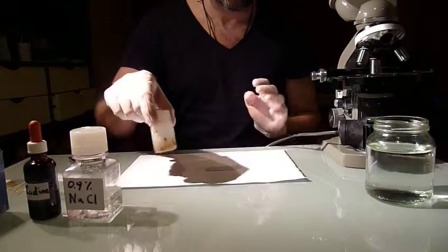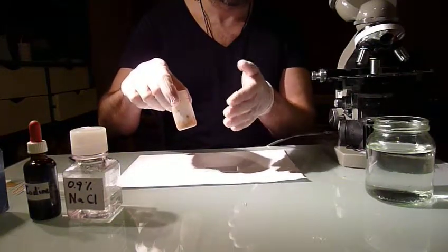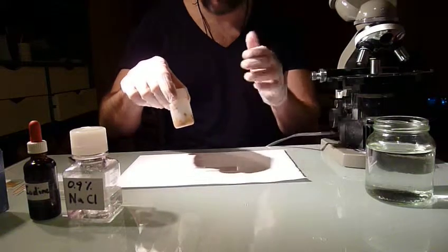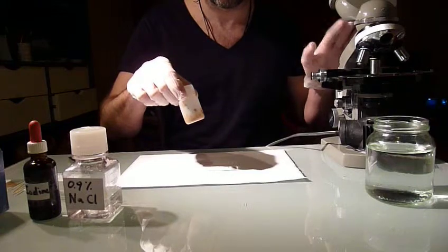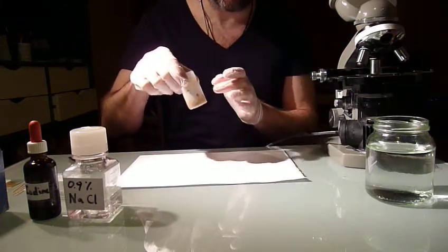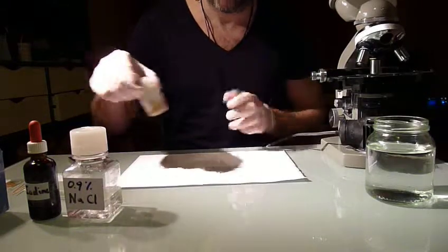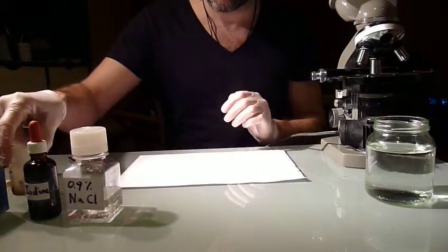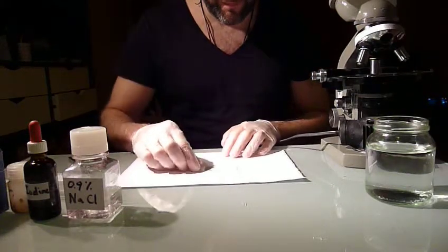Although this sample is actually not infected, I created a sample of stool and I added some yeast in it, so you get an idea of later when we look under the microscope what the size is of the cysts. But so it's actually a stool sample contaminated with yeast rather than cysts, and for now it will have to do the job. So the procedure is actually quite simple.